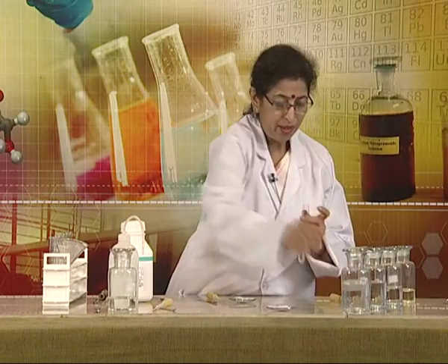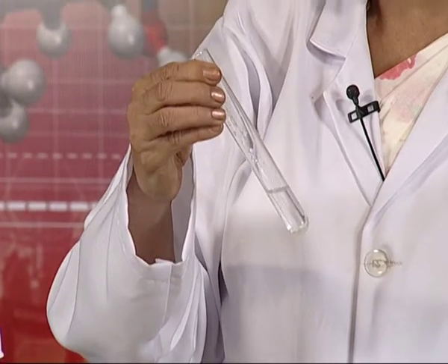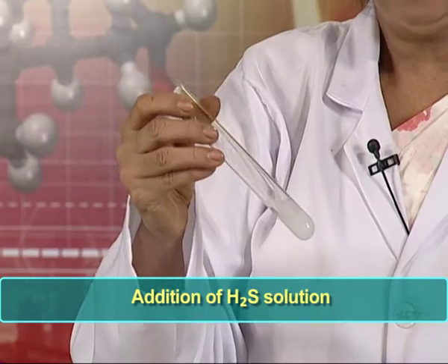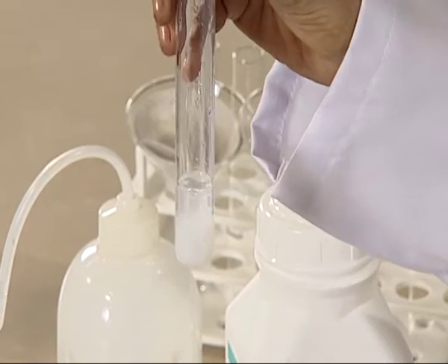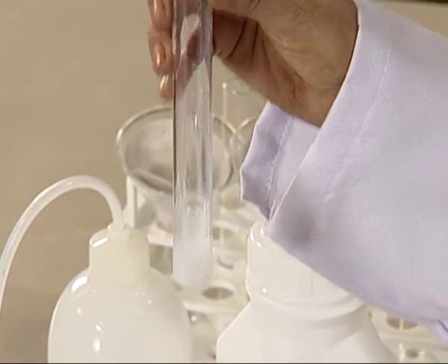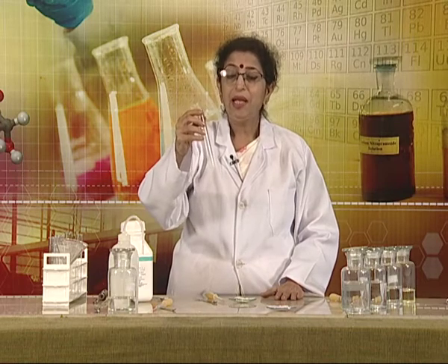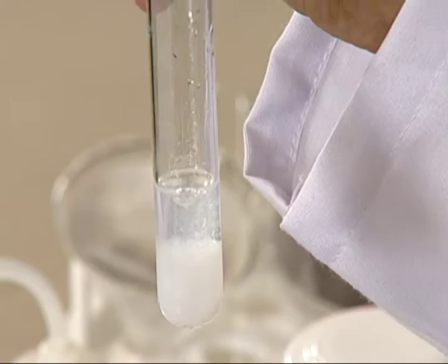Now, in this solution, we will add hydrogen sulfide solution. A white colored precipitate is obtained after the addition of hydrogen sulfide. This white colored precipitate is due to the formation of zinc sulfide. The presence of this precipitate indicates that zinc ions are present in the given salt.